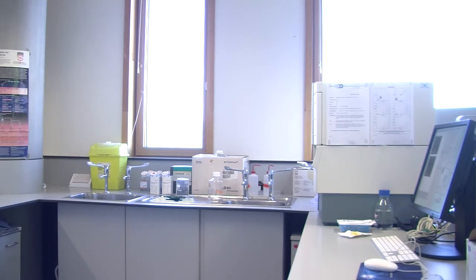Now, it's a daily thing. So if we were to run this again next week, we would have to run the isotype matched controls again, because it could be that one of the cell types goes really sticky when the CO2 in the incubator drops to 2%. Now, it could be over the weekend there's a problem with the CO2 cylinder, and for half a day it's at 2%. So one of our cell lines becomes sticky. We don't know that. So we would have to run these isotype matched controls every time. Because then, if our cells one week are really sticky, it doesn't matter because we're still setting our baseline on the background stickiness. Okay? Whatever it might be.